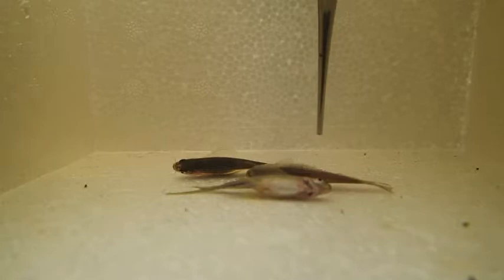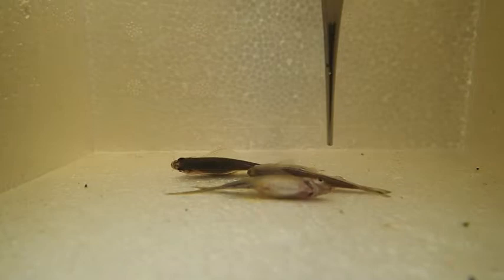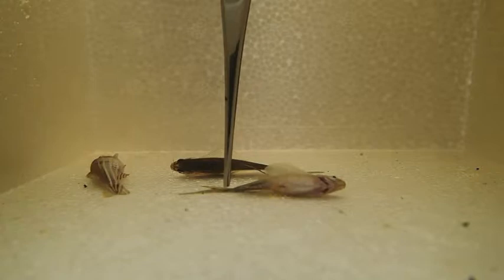You can see that there are still spinal reflexes at this stage. We're not quite at stage 4 yet, but depending on the fish — like this one here — it's not reacting at all.